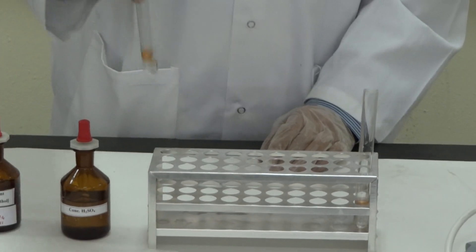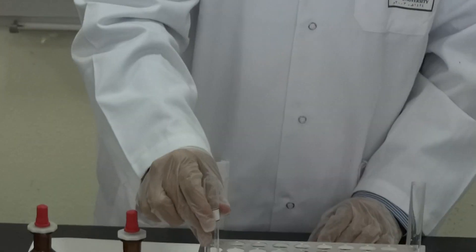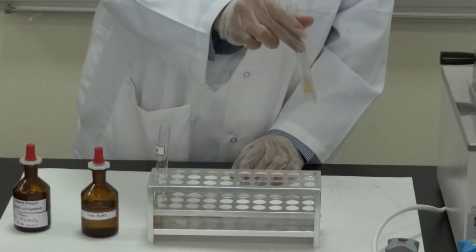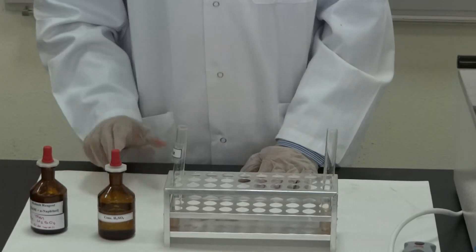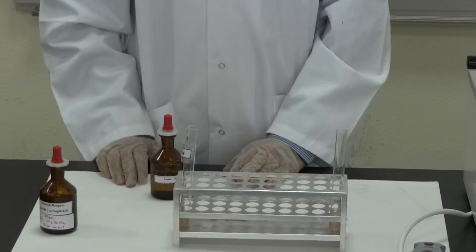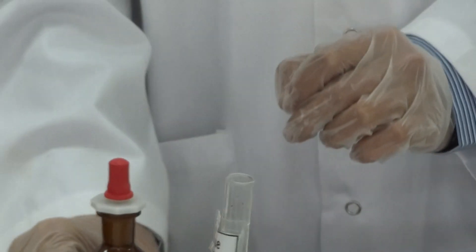Next step, shake a little bit. Remove the serum, use the control. Now, it's coming to the next step, which is adding concentrated sulfuric acid. Very, very harmful, you have to be very careful.